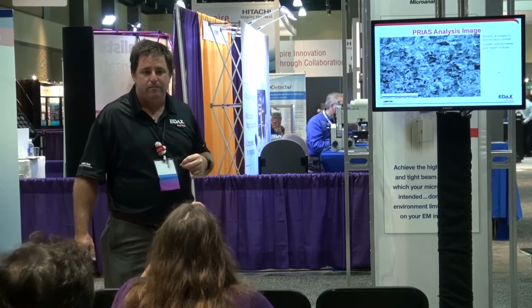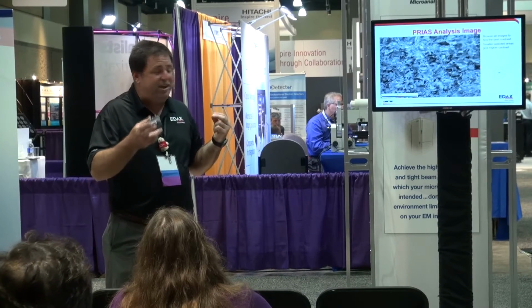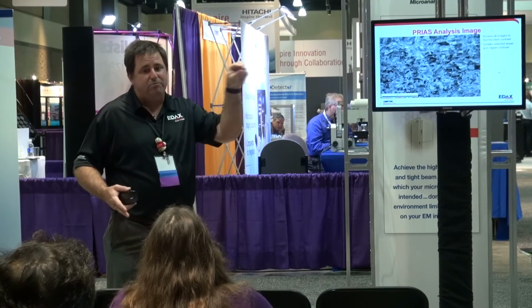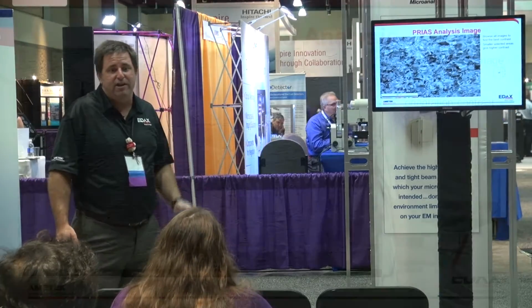Were you just looking for the poles? In this case, it was just random. We just picked an area. That leads to a great question: when it's textured and you know what orientations are of interest, you can be much more selective of where your poles are. You can put those ROIs there and look for small shifts from a known orientation. So the more textured it is, the more you can glean from that.